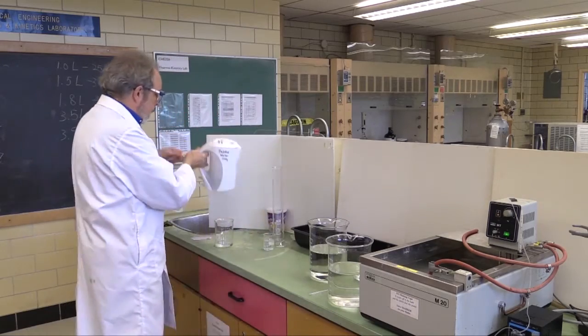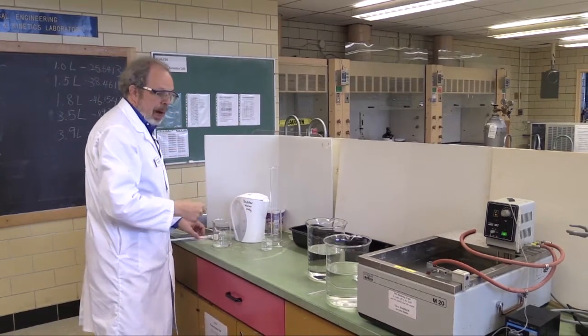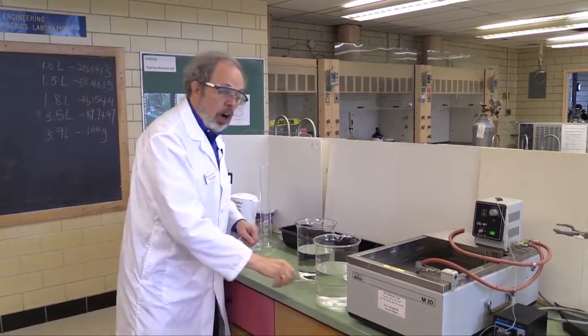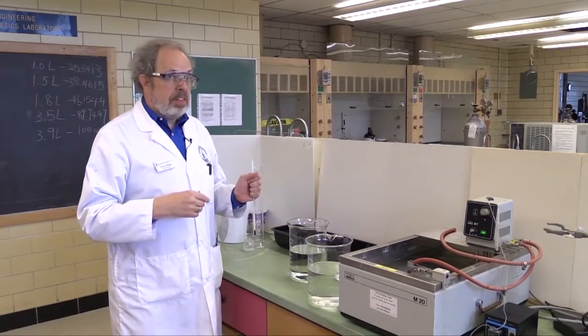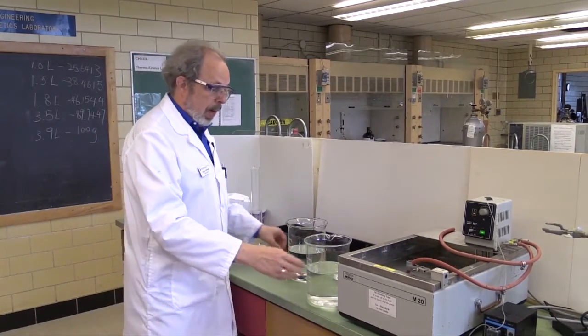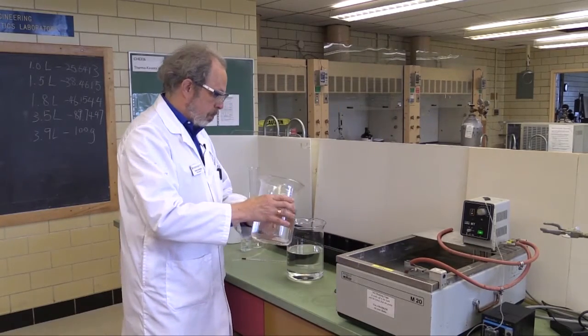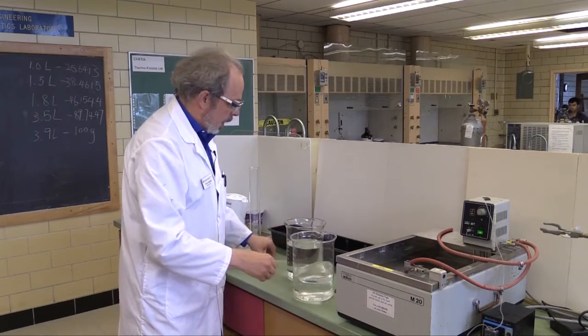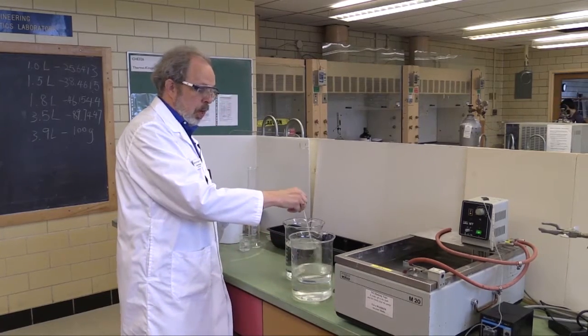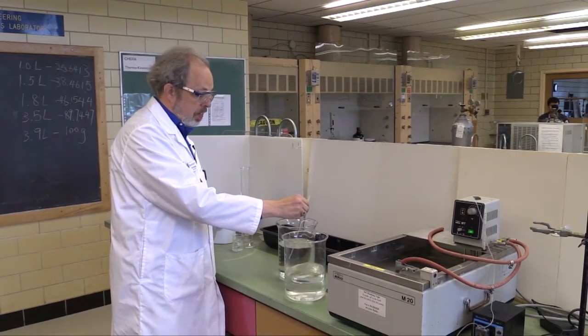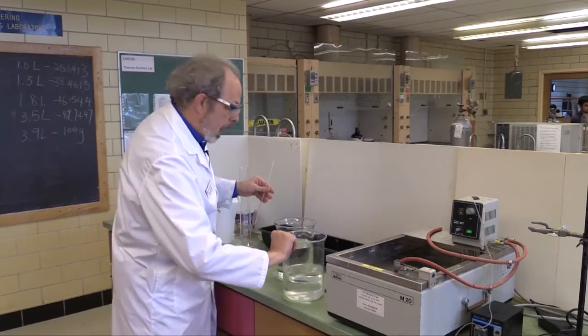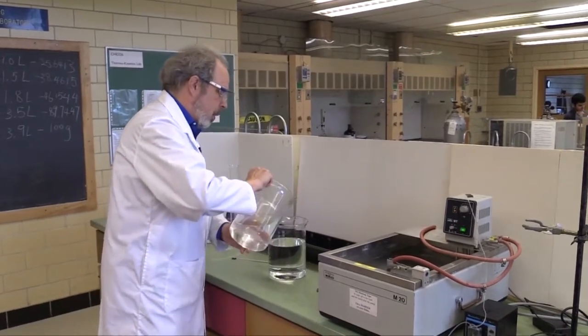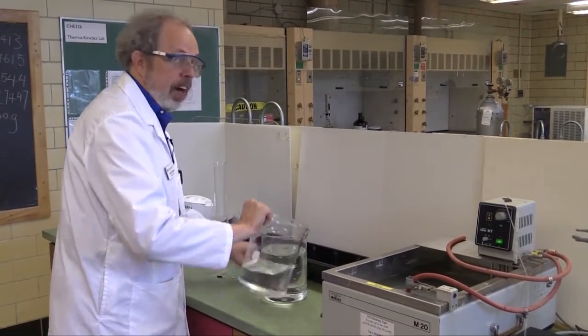This is actually cold water, but you should be using boiling water into a beaker, and you need to have about 2.5 liters of about 65-degree water. So, have another beaker of room-temperature distilled water, add it, and stir with a thermometer and check what the temperature is.